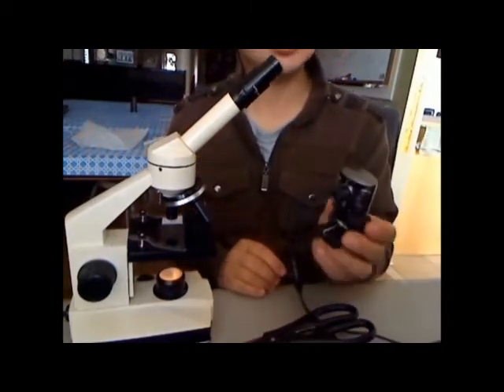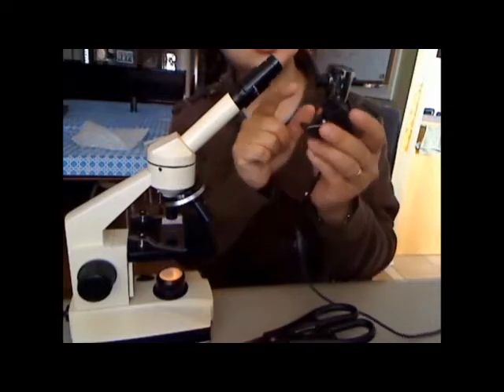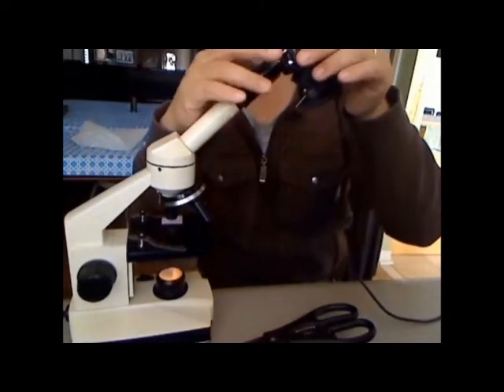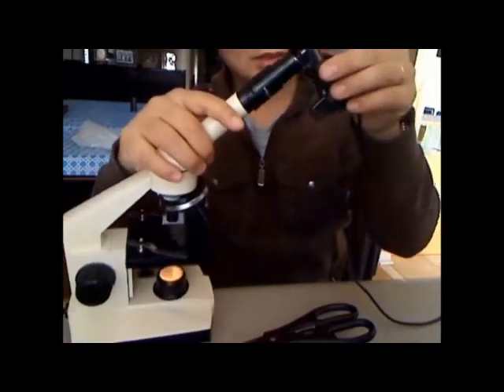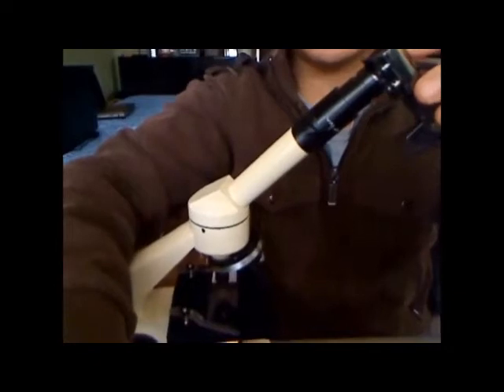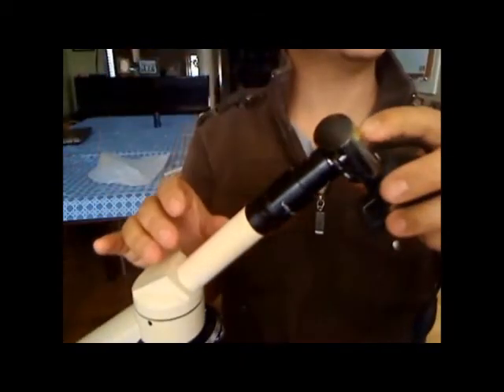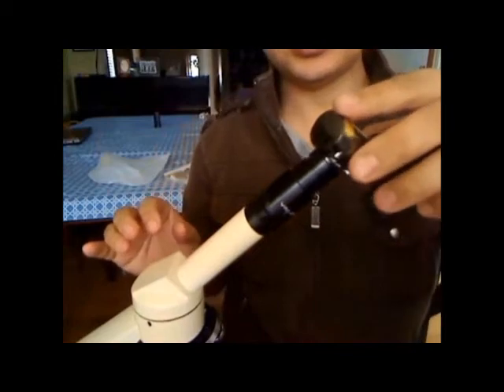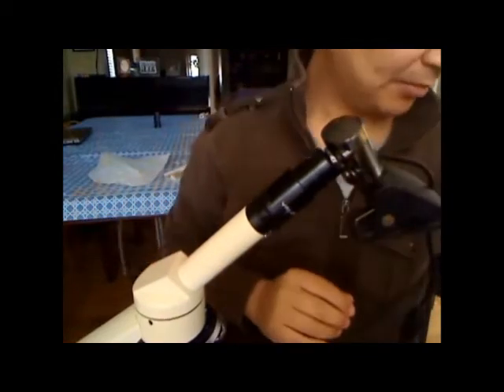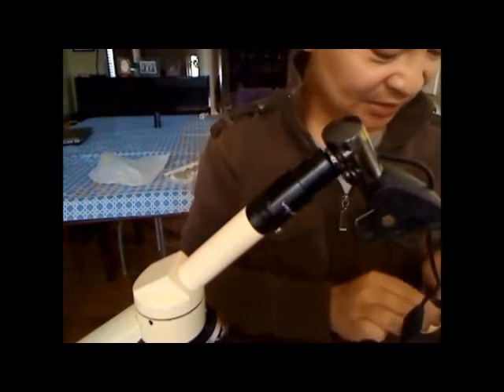Now take the USB camera. Because of the lens here, you're just going to put it on top of that. Then put a tape around it to secure it — and you're done. It's not easy to do cleanly, but it works.